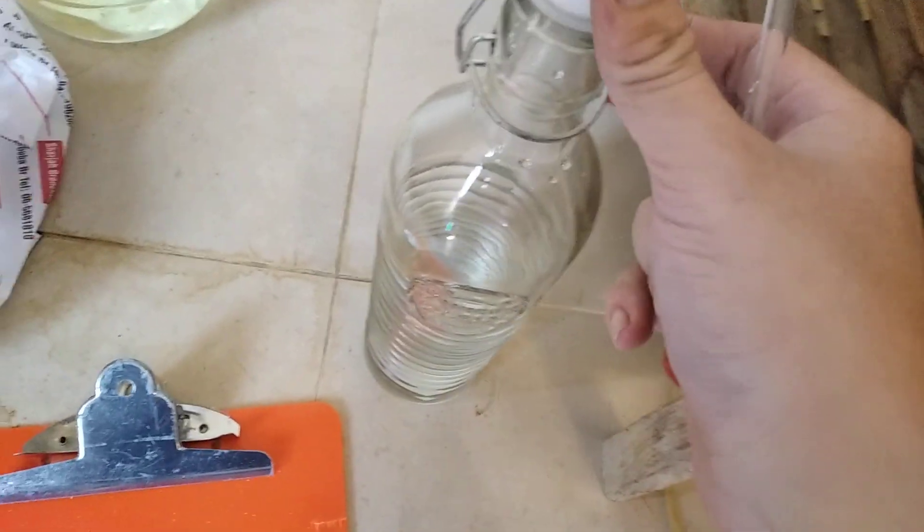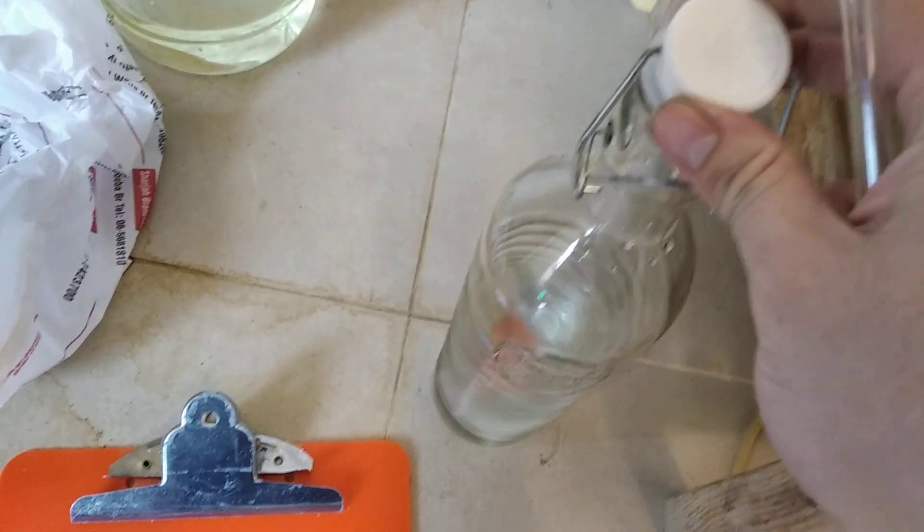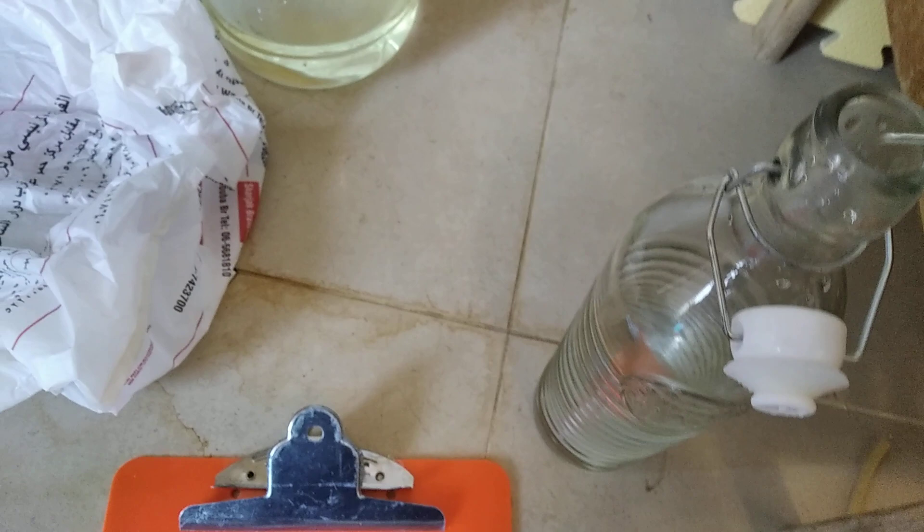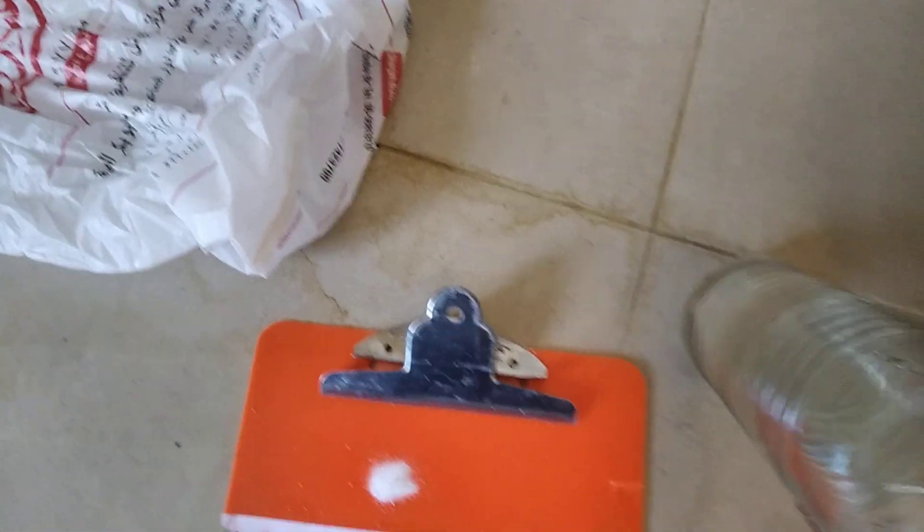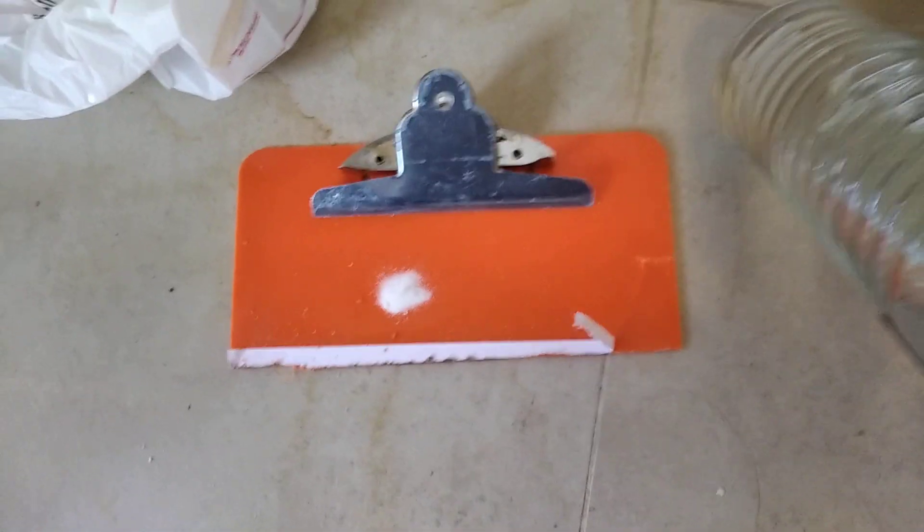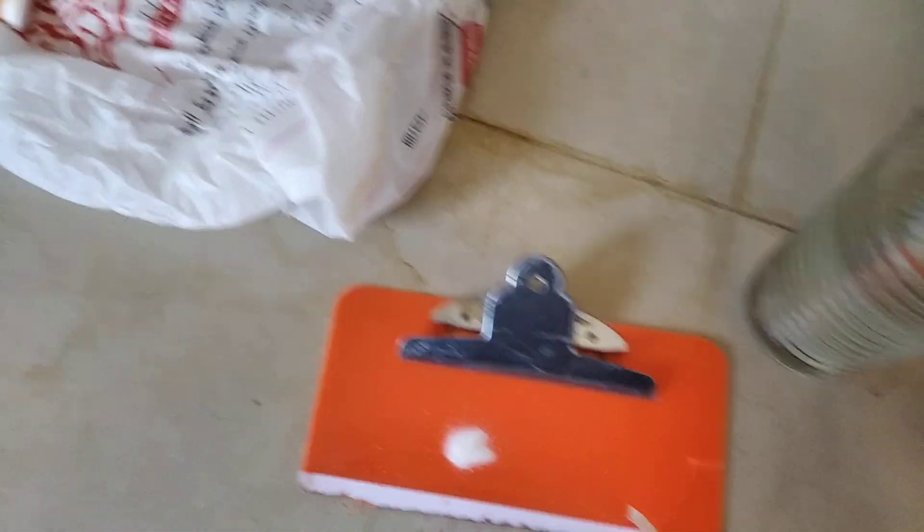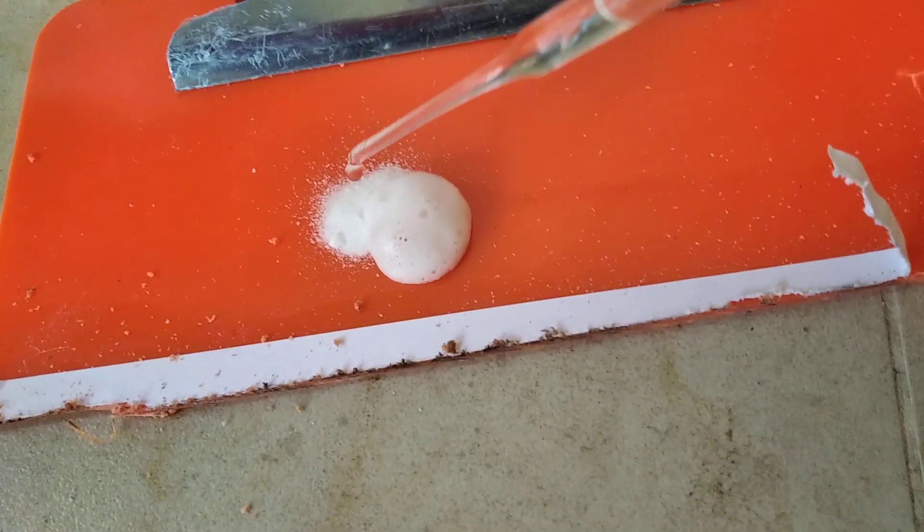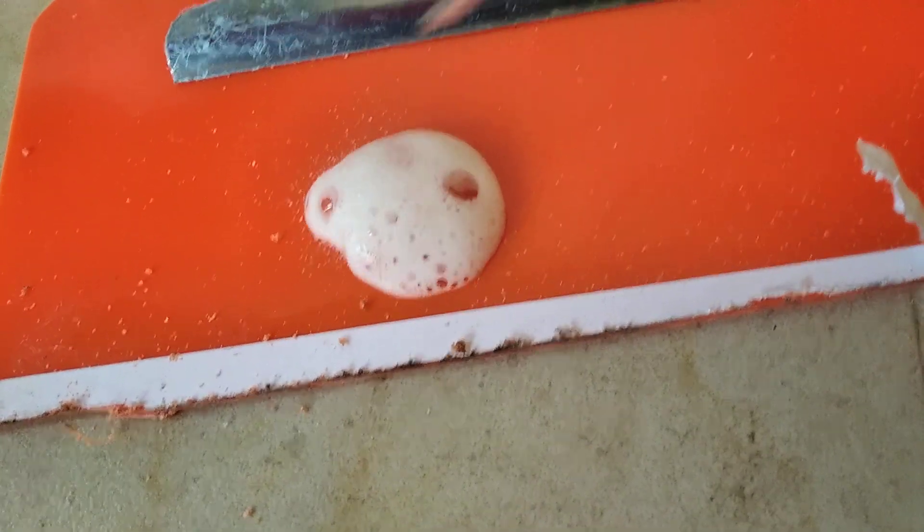Over here I have some of the hydrochloric acid from previous run. This is all plastic, the only metal is on the outside. So I'm gonna go collect some. I'm gonna drop it onto some baking soda. That works pretty well to be honest.